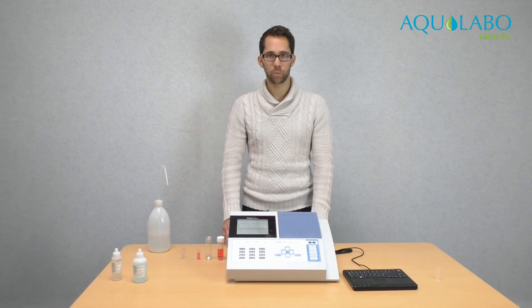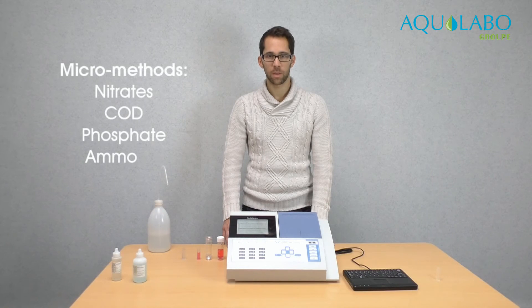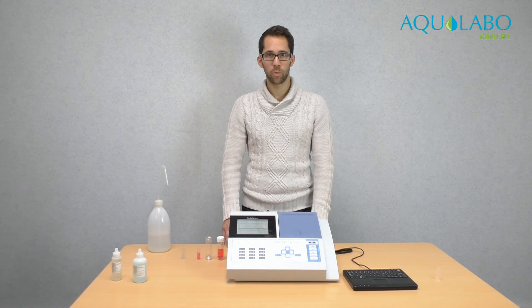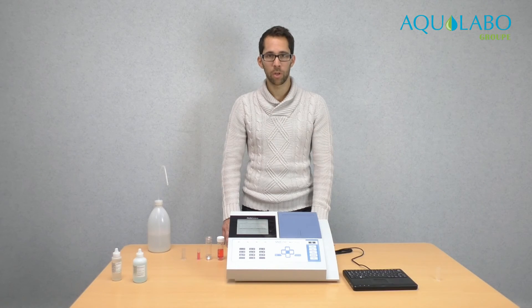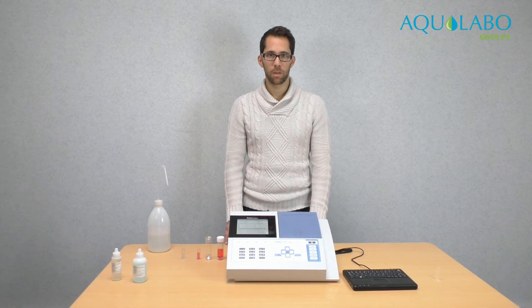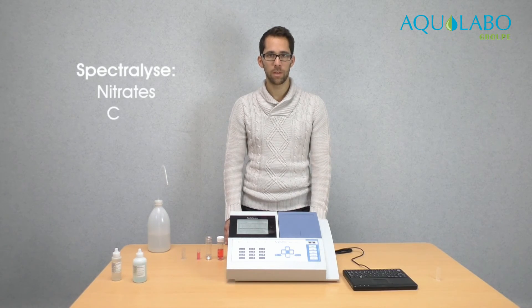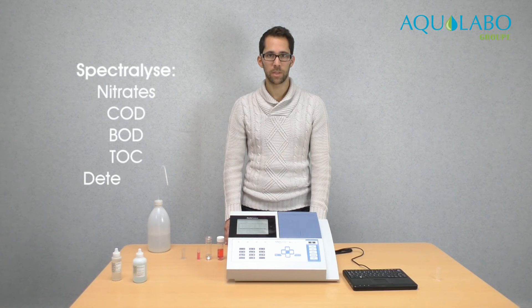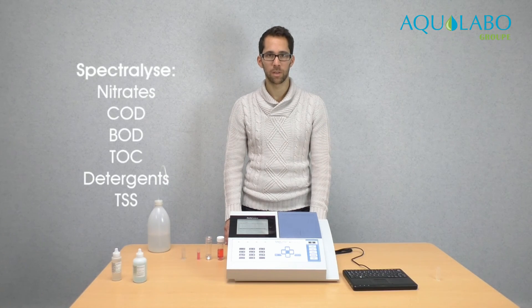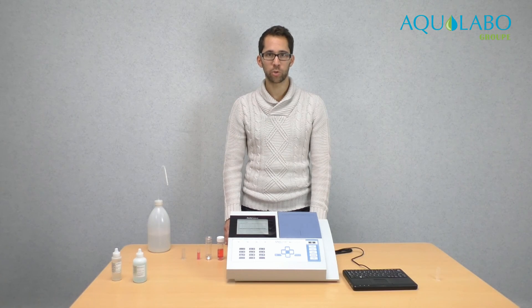The parameters measurable with reagents are nitrates, COD, phosphates, ammonia, and total nitrogen. However, if you wish to measure other parameters, you can record new methods. The parameters without reagents are nitrates, COD, BOD, TOC, detergents, and suspended solids. It is possible to measure all of these parameters in just one analysis.